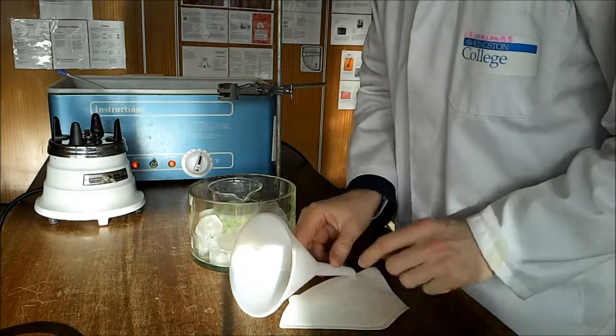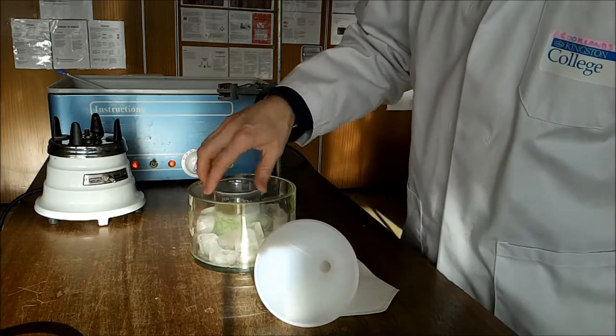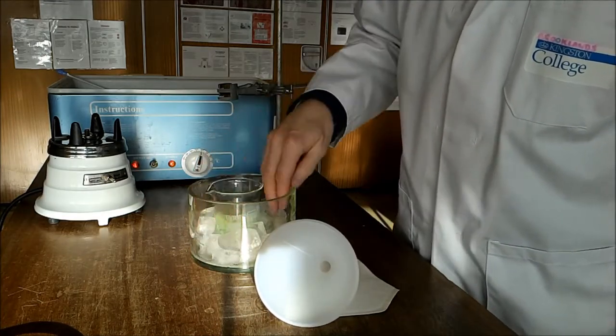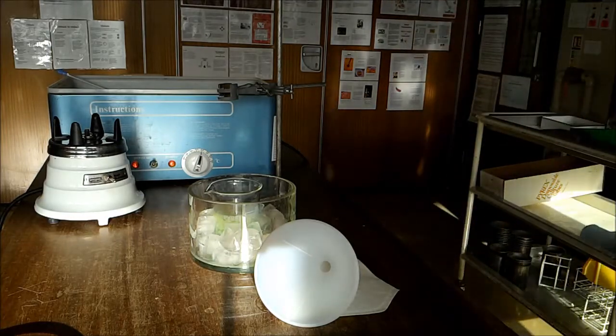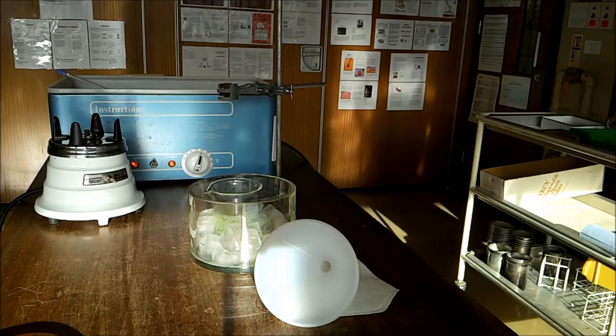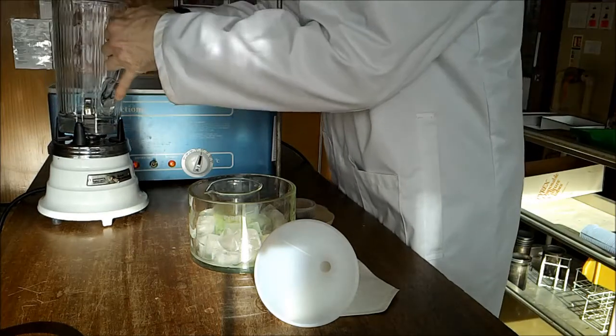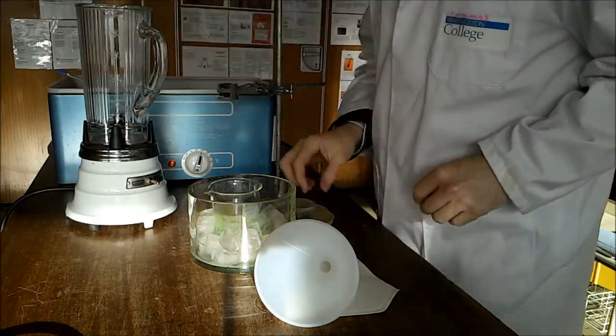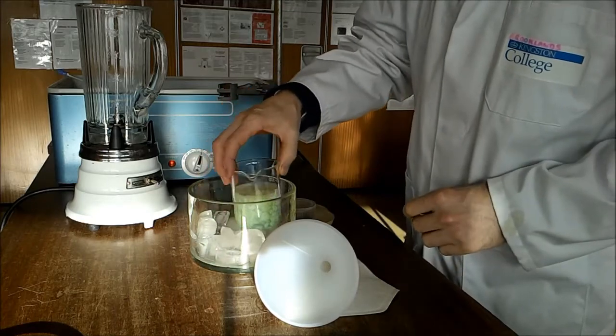Then we're going to blend the mixture. Once that's cool, we'll pour it and mix them together.